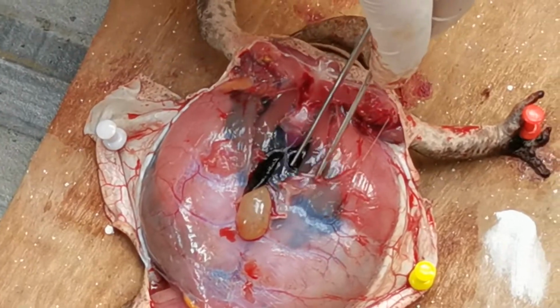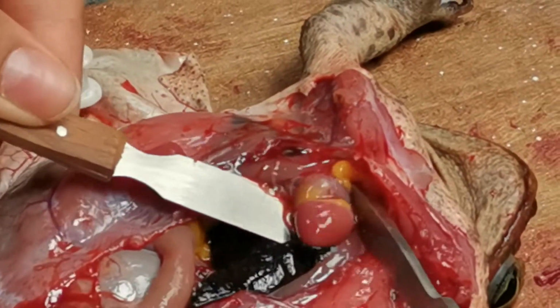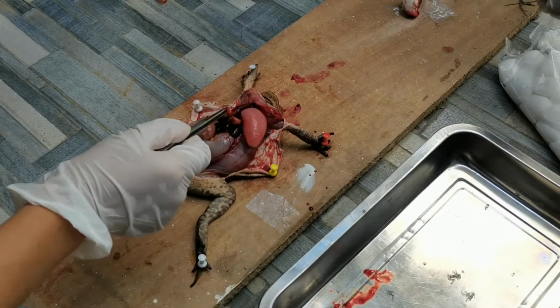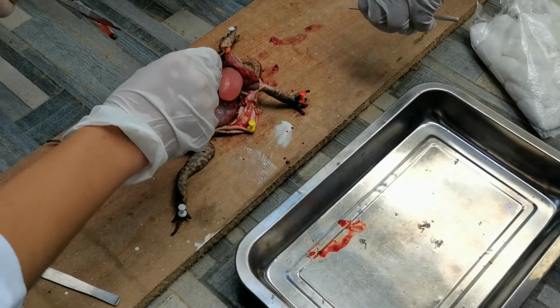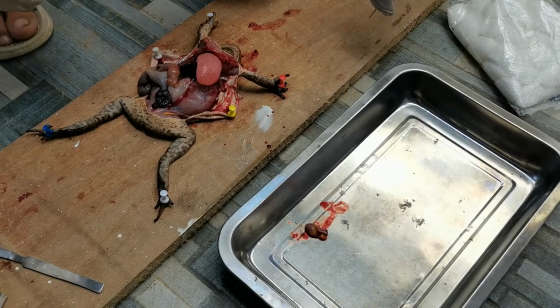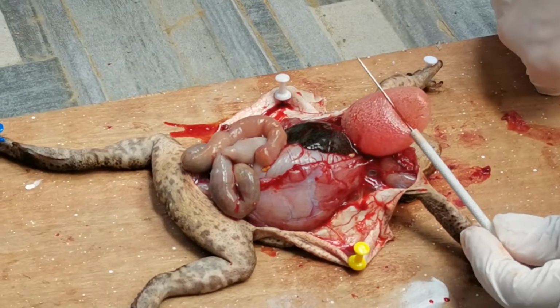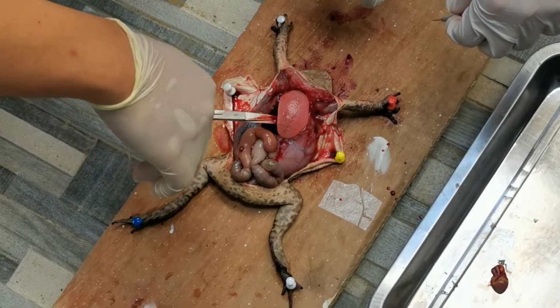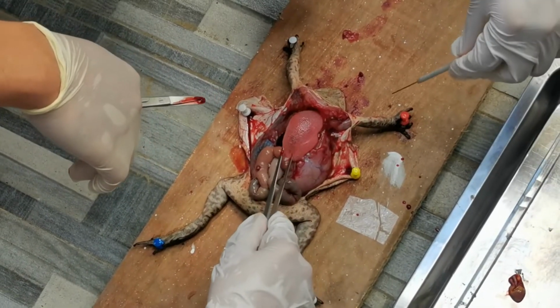The two dark-walled chambers, called atria, receive blood. The right atrium receives deoxygenated blood from the veins of the frog's body. The left atrium receives oxygenated blood from the lungs. Each atrium empties into the ventricle, which is the lighter-colored, thick-walled part of the heart. The large vessel forming a Y shape at the anterior end of the ventricle is the conus arteriosus. Blood is pumped out of the conus arteriosus through a system of arteries that you see around the heart.